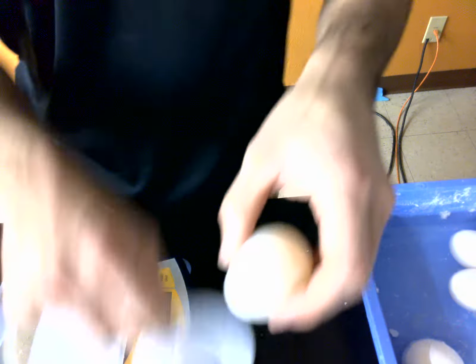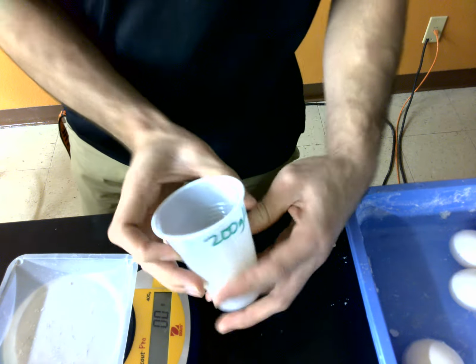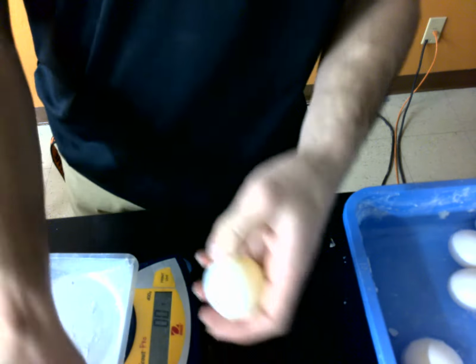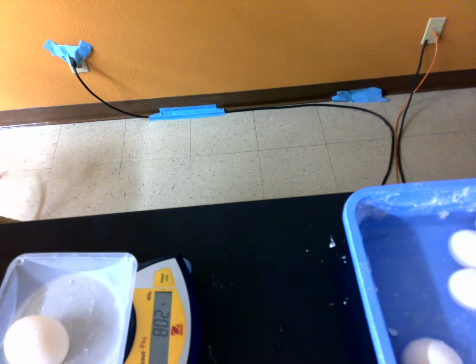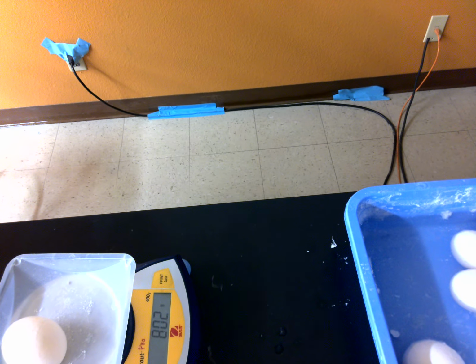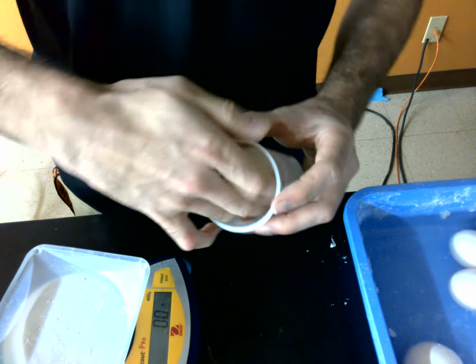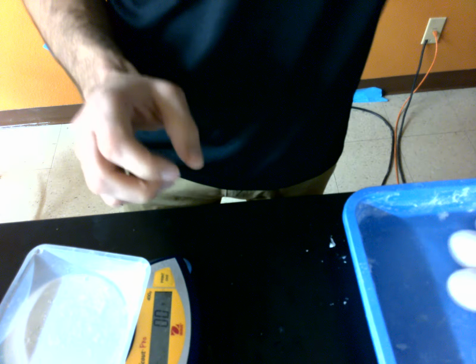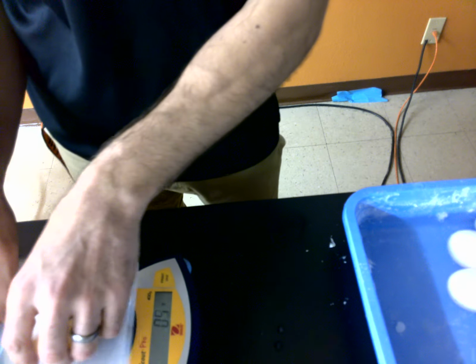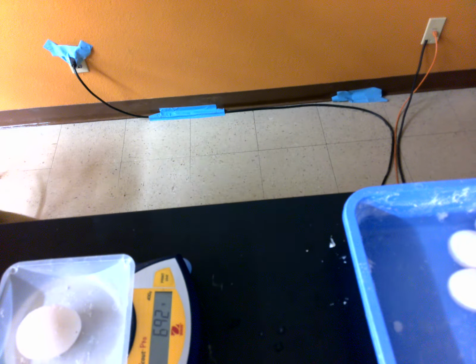Okay, put that back in the cup as well. Egg 3, this is the 200 gram one. We are going to weigh that. It's a big sucker, 80.2 grams. Egg 4, let's put this back very gently. They are kind of prone to breaking, actually. We'll get the next egg, put it on the scale. That says 69.2 grams.